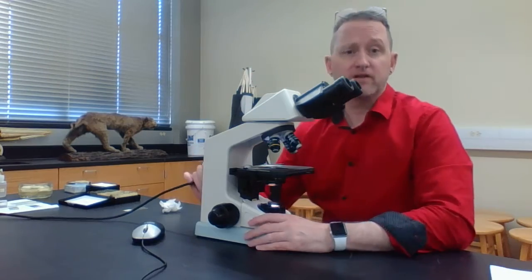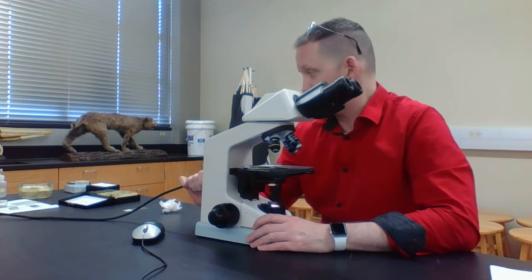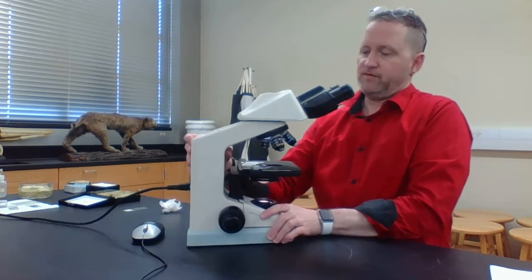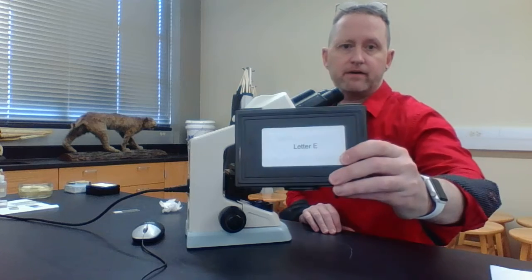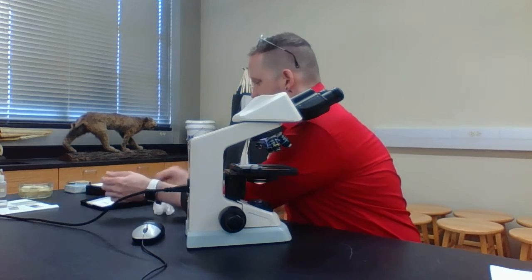I'm thinking what we can do is go ahead and start with the exercises I've got for today. I've got 4 exercises that I want you to do today. The first one is something referred to as the letter E. I've got a microscope slide box right here called the letter E, and I'm going to open it and pull one of these letter E's out.